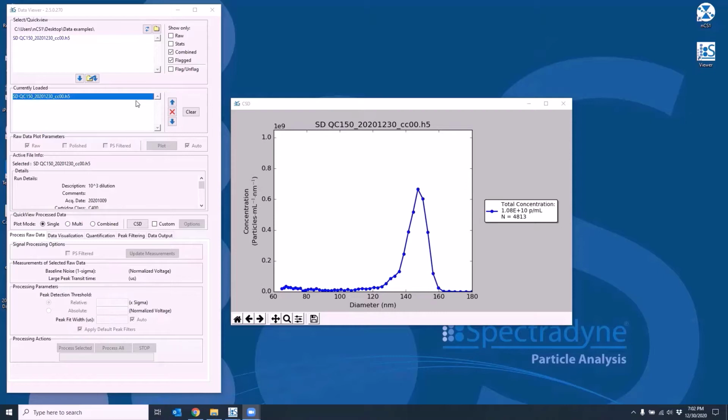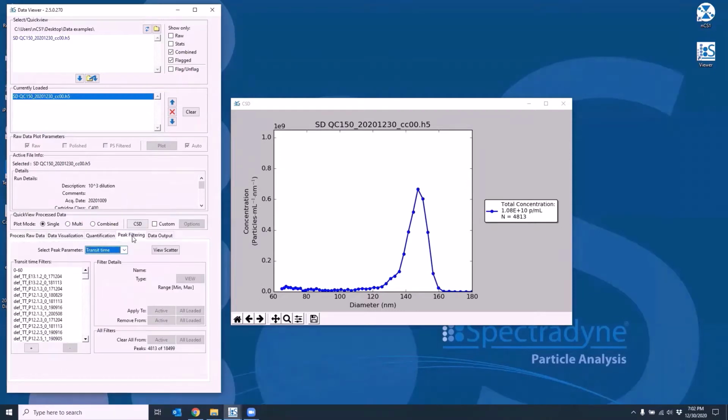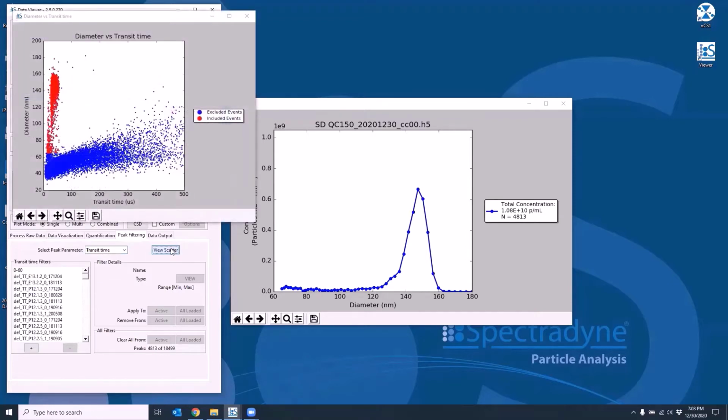Navigate over to the peak filtering tab. Here you can plot any parametric scatter plot by using the Select Peak Parameter drop-down list and click the View Scatter button. Let's take a look at what the transit time scatter plot would look like for this data. This will plot the diameter on the y-axis versus transit time on the x-axis.